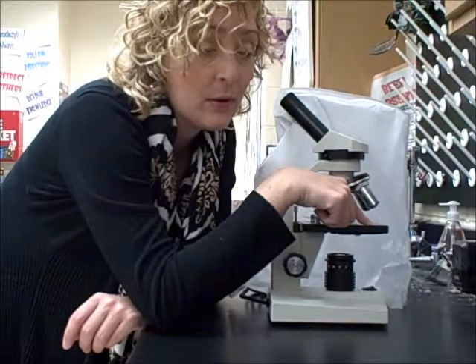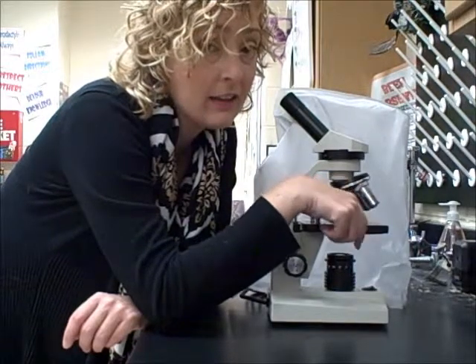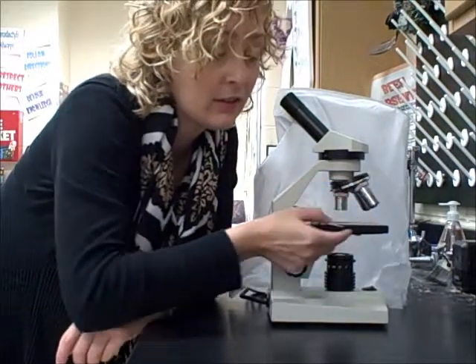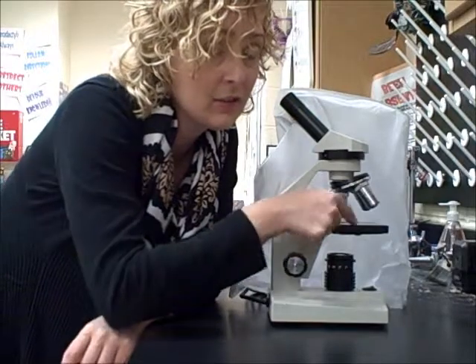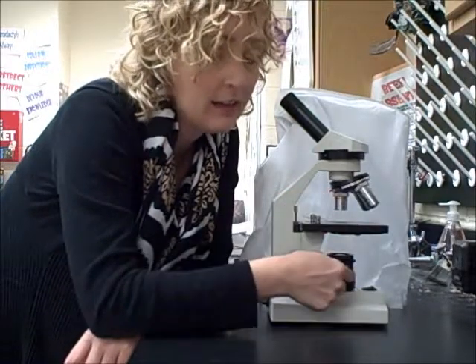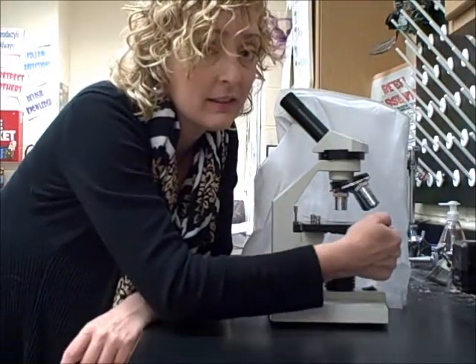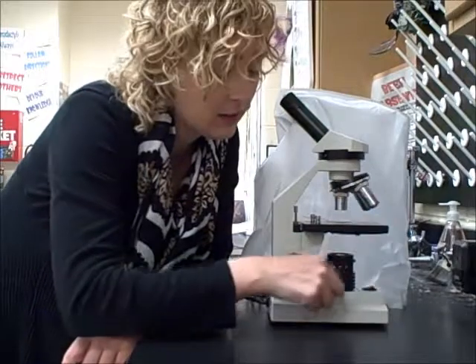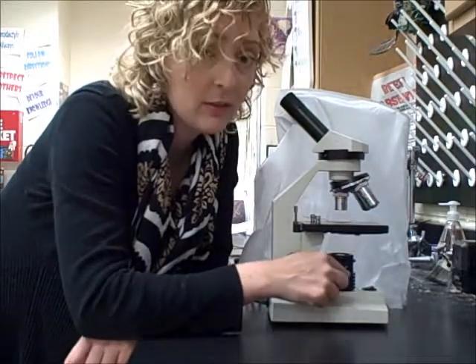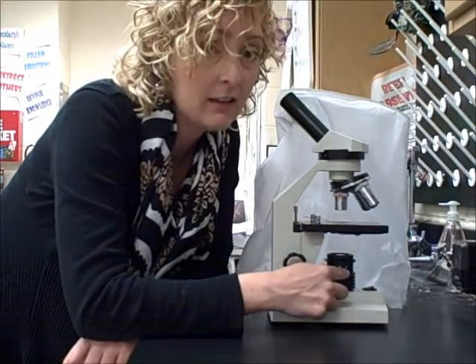The stage is holding the slide. The slide is secured by the stage clips. The light is controlled by the diaphragm. The base is holding the light.